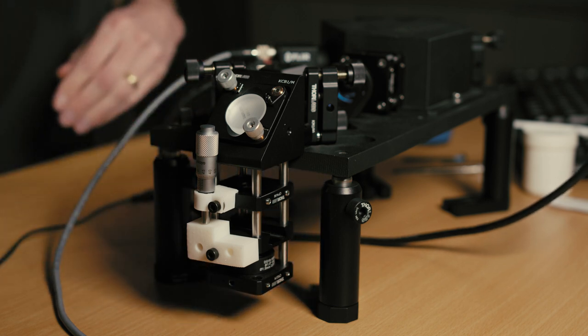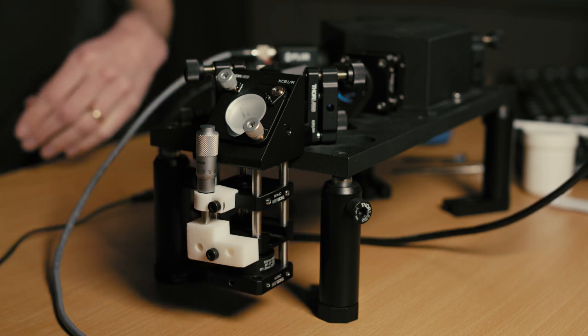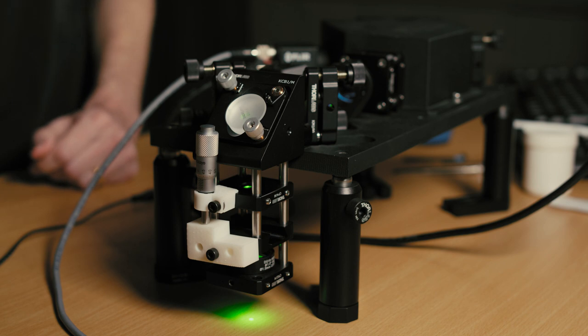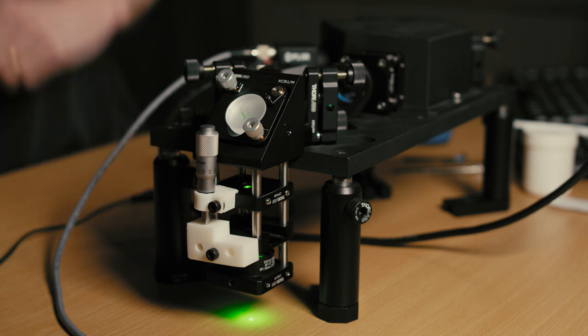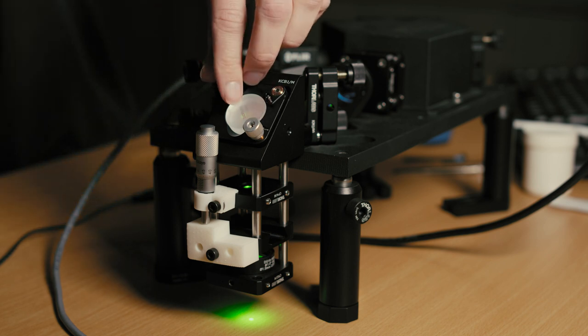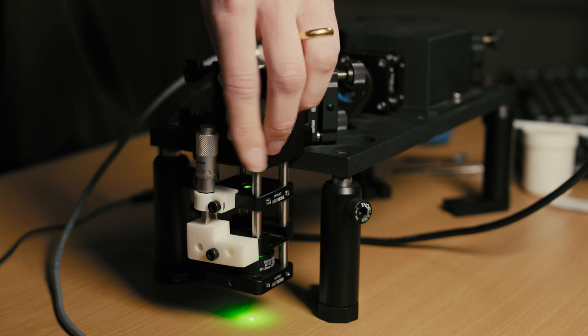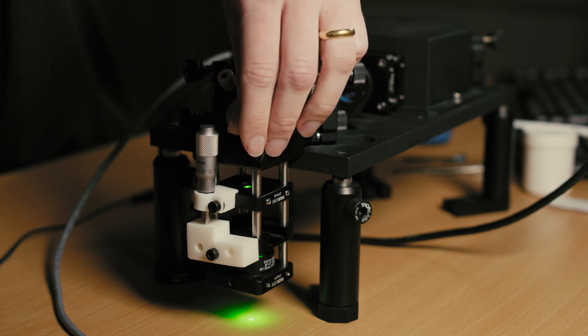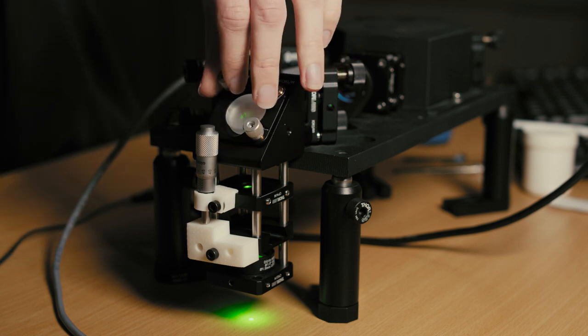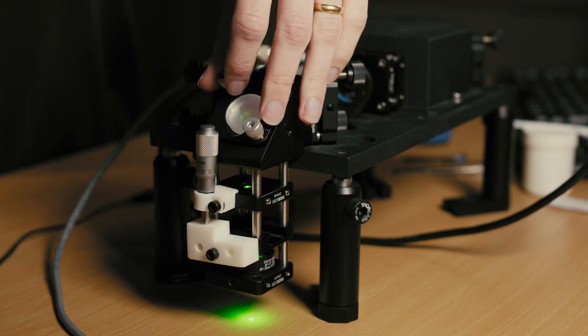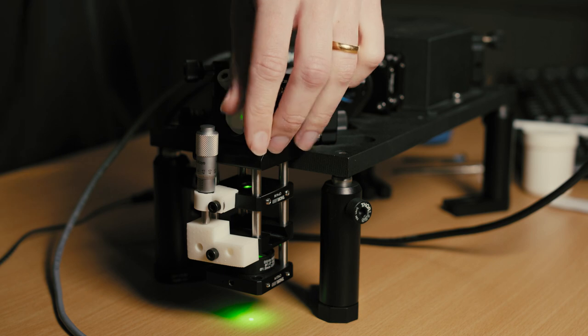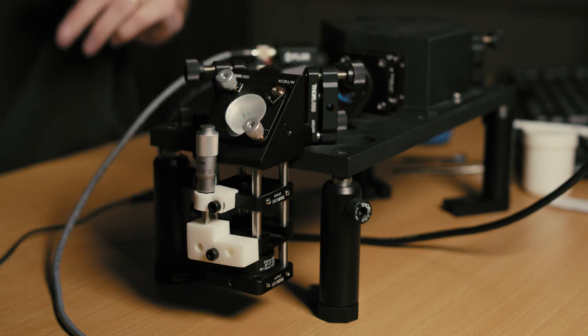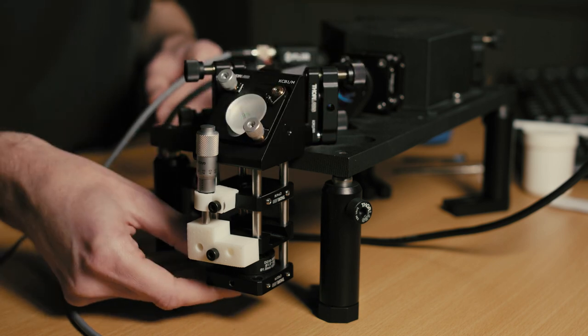I will switch on the laser and I can see that the laser is passing by the hole so you can consider that this is aligned. So switch off the laser.